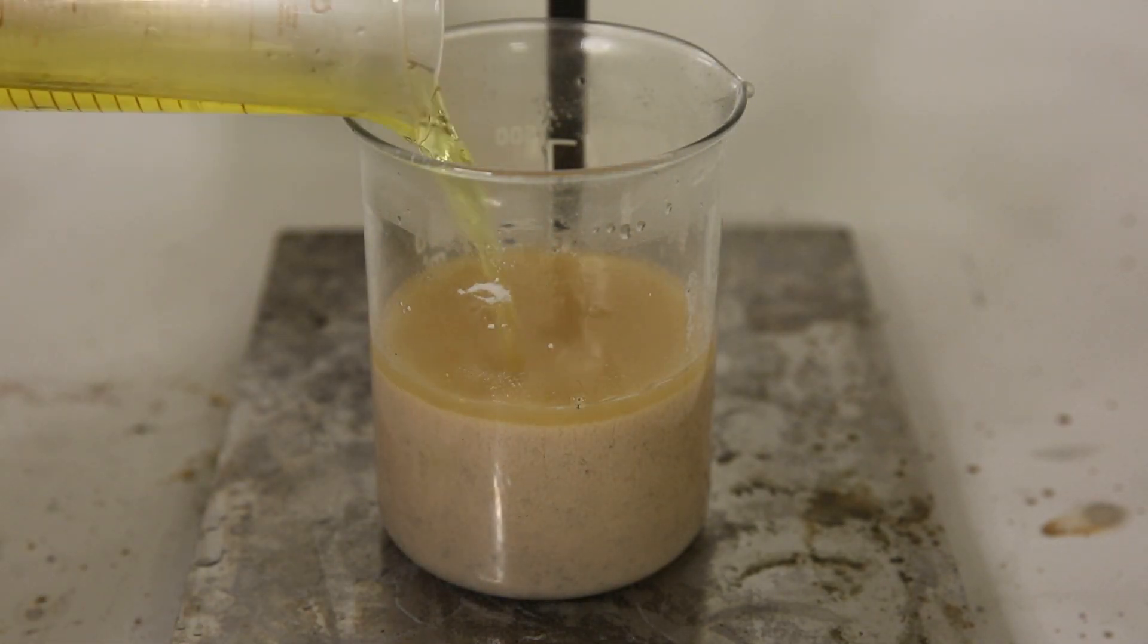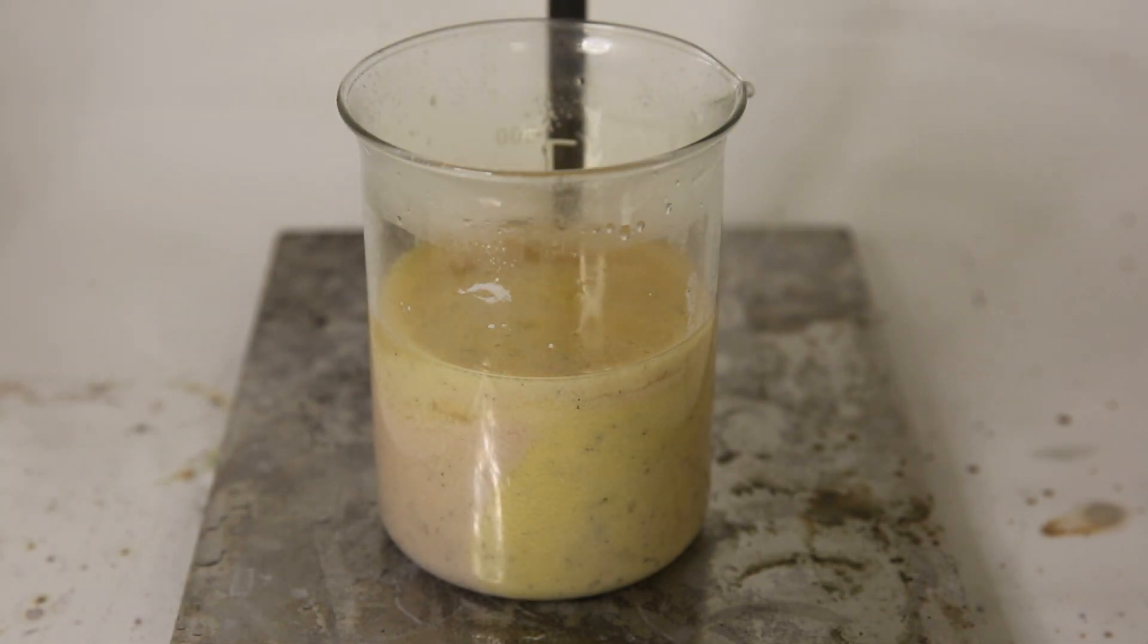To make sure all the silver is converted to silver nitrate, I add a little bit more nitric acid and stir it.